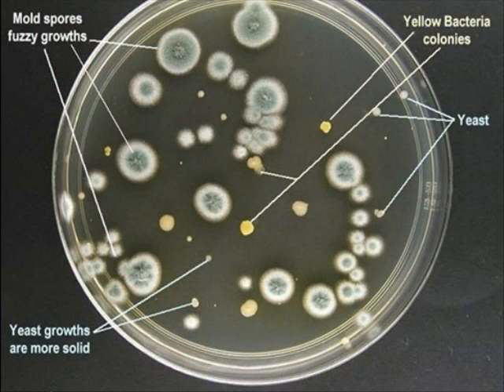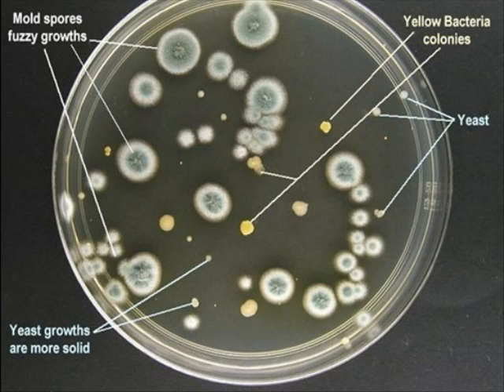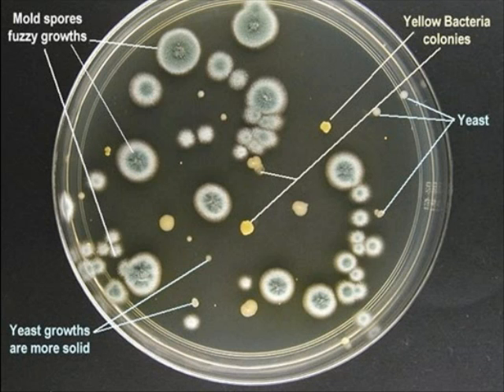Finally, Sabouraud dextrose agar is a selective medium. Its acidic pH selects for fungi such as molds, and especially yeast like Candida. Yeast colonies will look like bacterial colonies with a circular margin, off-white coloring, and a moist consistency. The odor will also have a yeasty smell. Mold will appear as fuzzy colonies, if present.